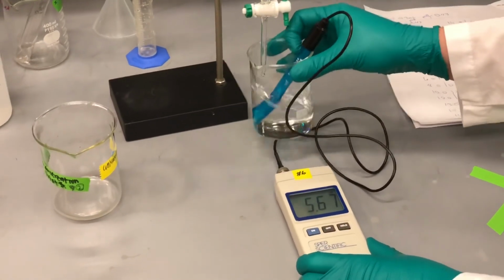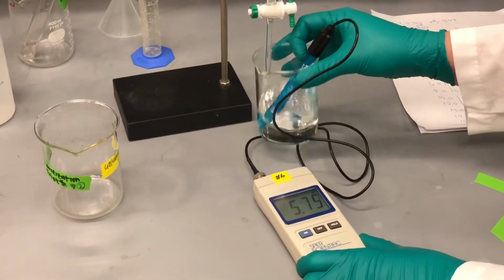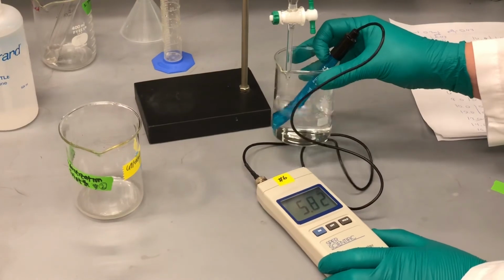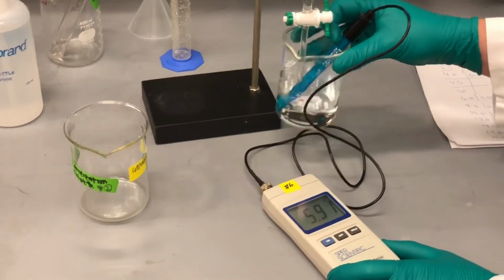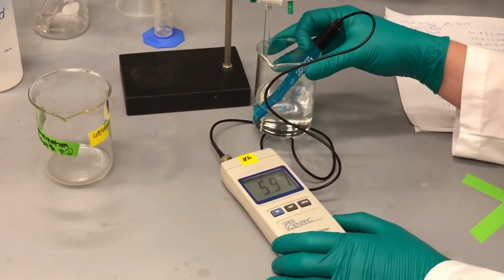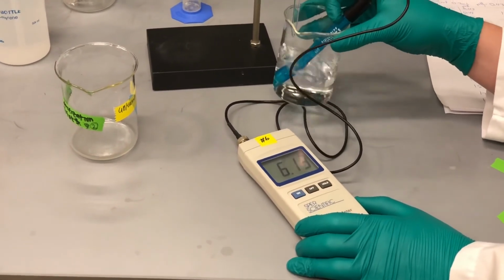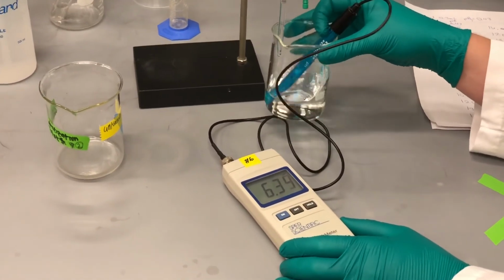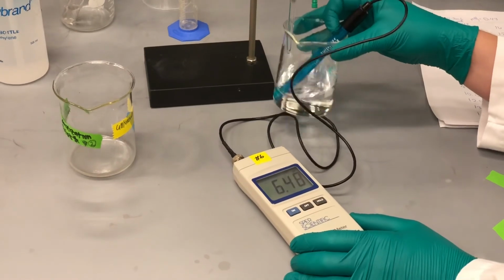33.5, 34.0. What the heck? 34.5, 35, 35.5, 36.0, 36.5, 37.0.